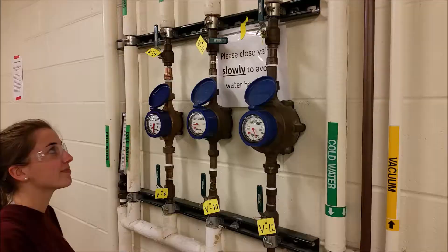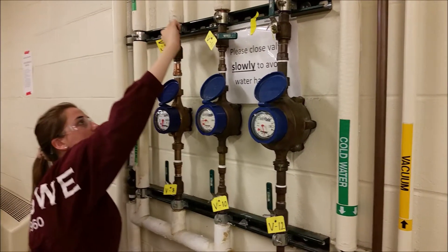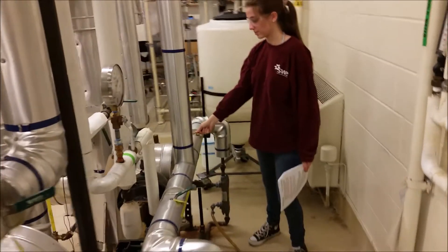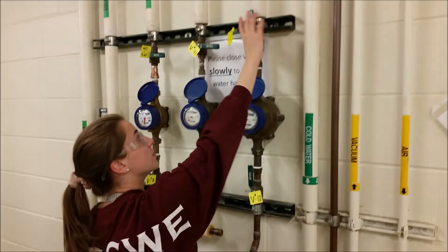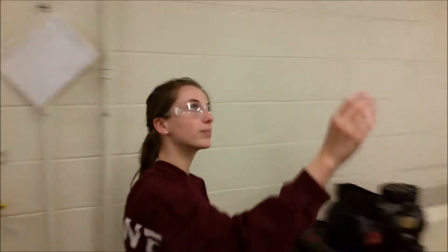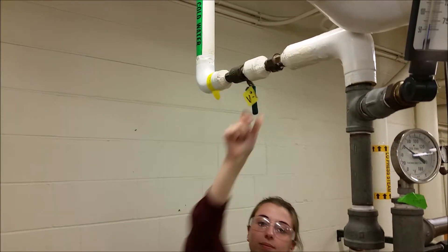At least 15 minutes after the steam has been turned off, turn off the cooling water. Ensure V11 is closed. Close V9, V6, V7, V13, and V19. Do not drain effects A and B. Ensure the area around the system is clean and organized for the next operation.